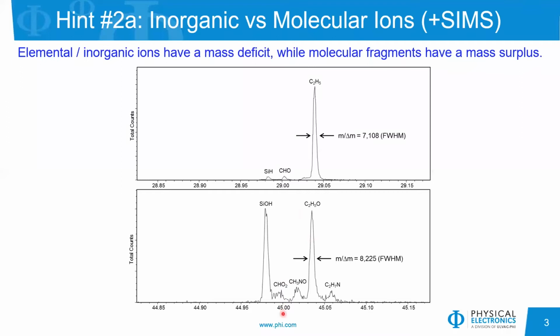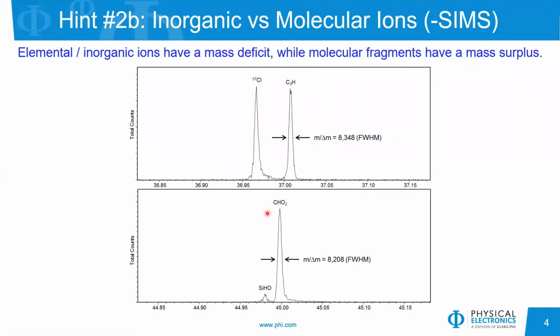Here's another one at a nominal mass of 45. Again, we see silicon hydroxide at the low side with a mass deficit, and we see the organic fragment ion with a mass surplus. And keep an eye on the intensity of this silicon hydroxide peak. So this data that we're looking at in slide 3 is from the positive ion polarity. Now, if we look at the negative ion polarity, for instance, just coming back to the silicon hydroxide peak, notice that the intensity here is very low.